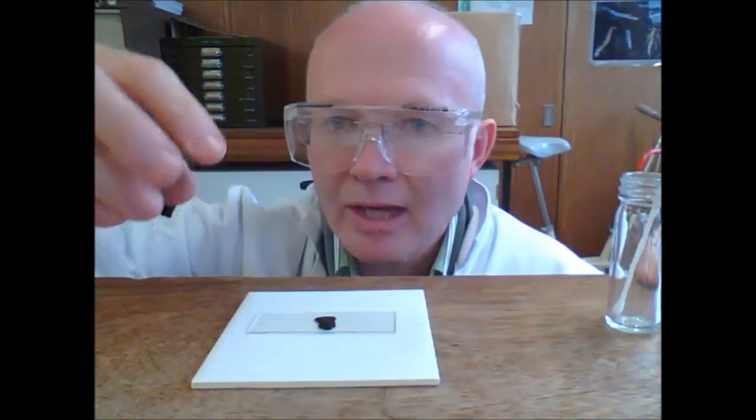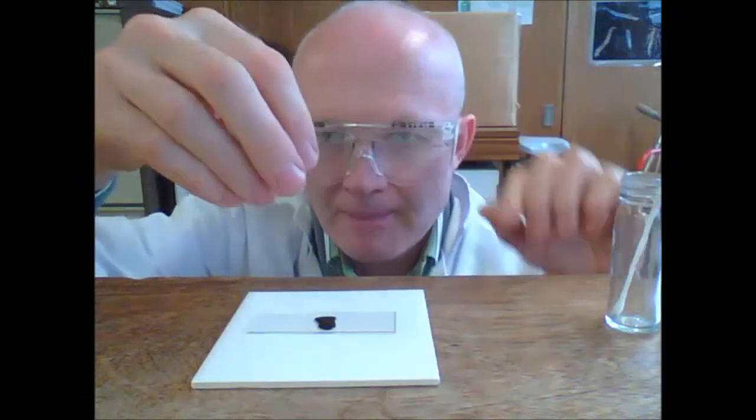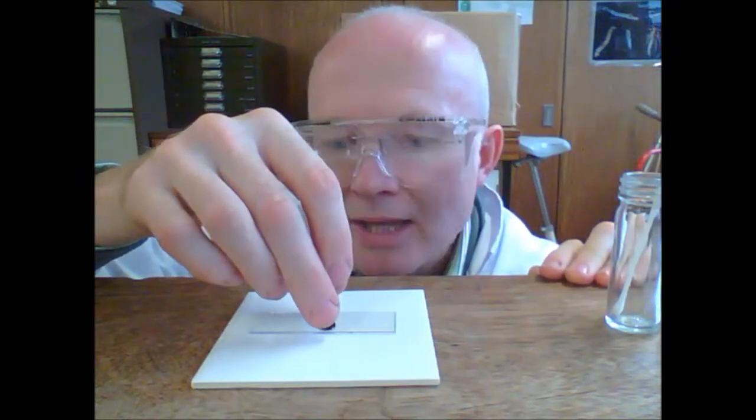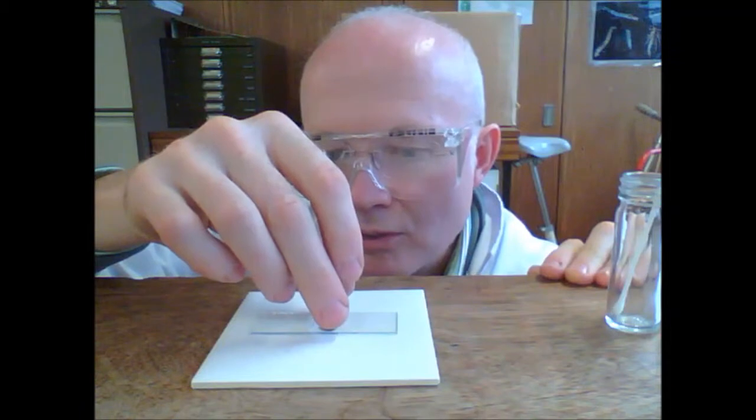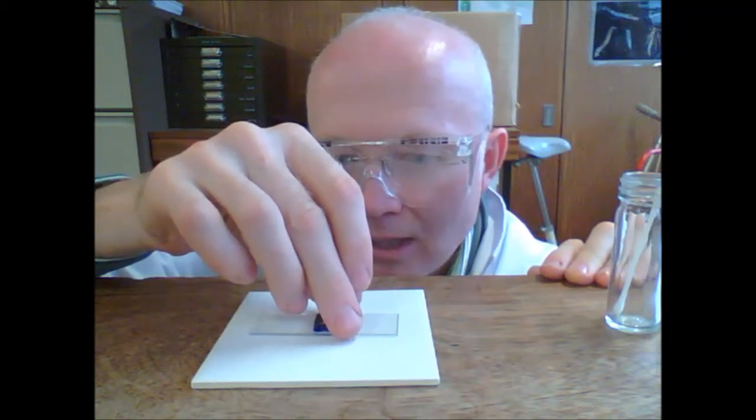Then take a cover slip, 45 degrees, touch the back edge of the cover slip onto your methylene blue, and lower, lower, lower, gently onto the slide.